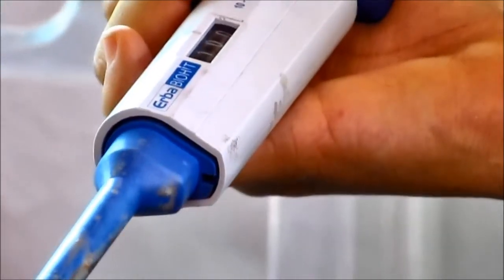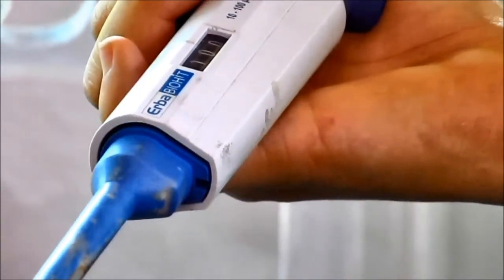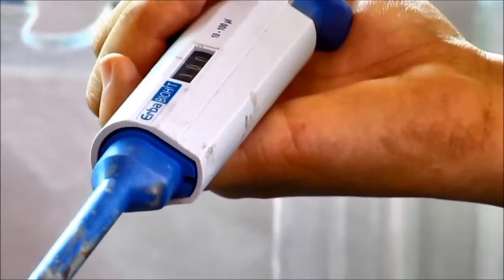This micropipette has a lower limit of 10 microlitre and an upper limit of 100 microlitre.